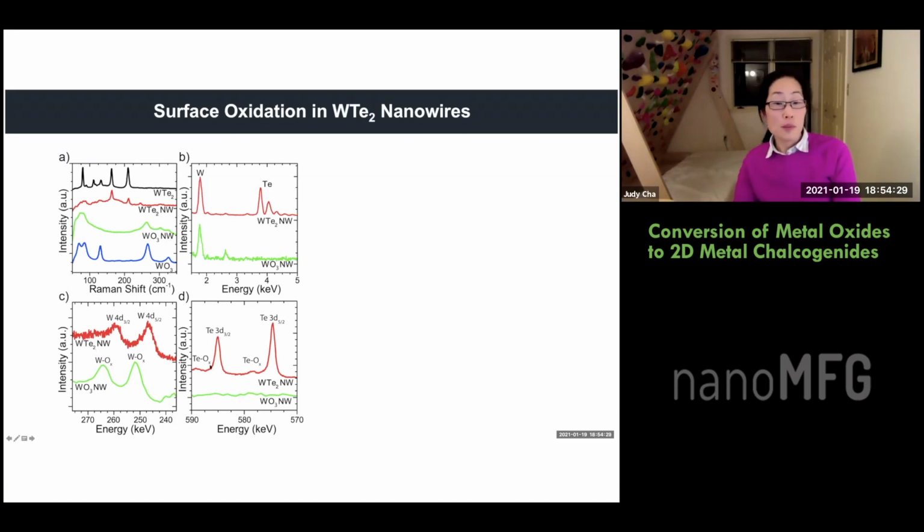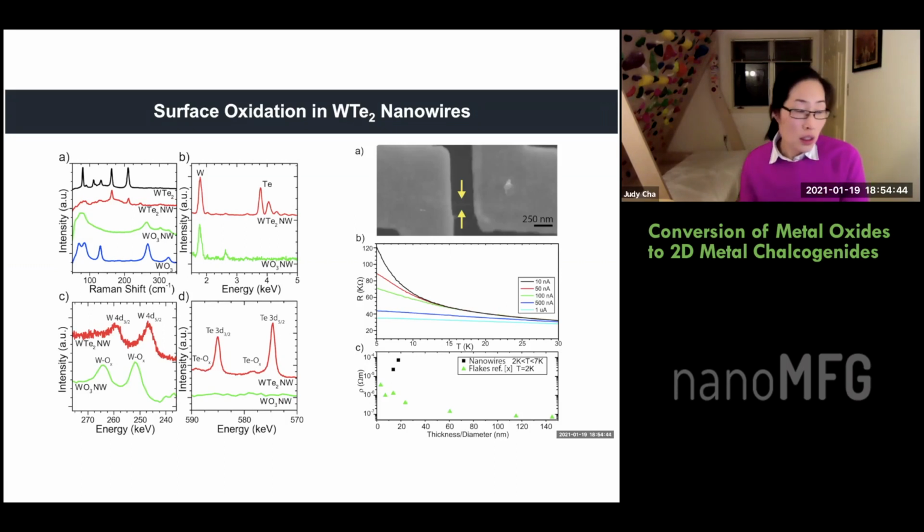So let's look at this XPS. Here's the tellurium 3d peak for the tungsten telluride, and here is the tellurium oxide species that you will grow with oxidation. And what that means is that you can just look at this bottom plot. When we do transport measurements, the resistivity that you measure on tungsten telluride flakes versus our nanowires, the resistivity of our wires is much, much higher. And I think this is all due to the surface oxidation. All that is to say that for a lot of wire studies, you have to spend time passivating the wires so that you don't have surface oxidation.